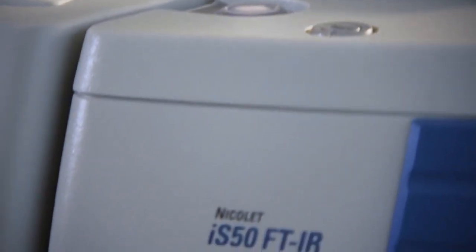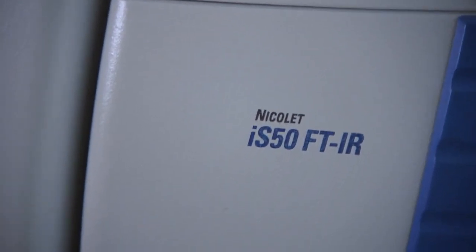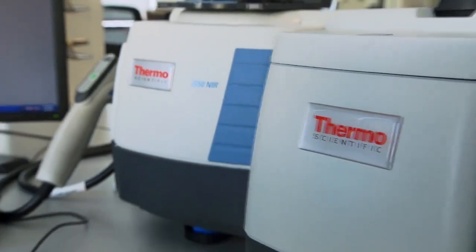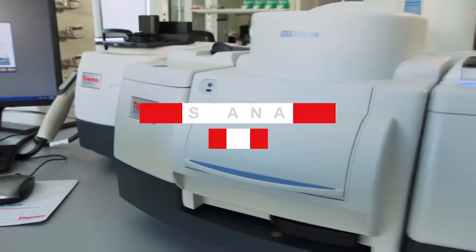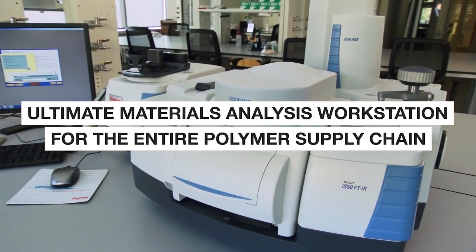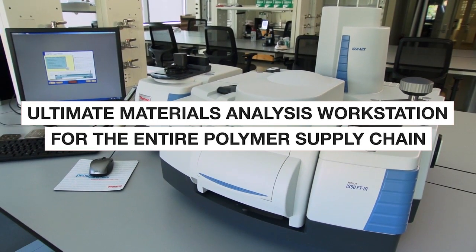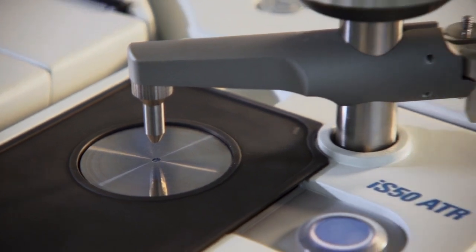troubleshooting, and deformulations. That's why the Thermo Scientific Nicolet IS-50 FTIR spectrometer, with automated optical configurations and multiple sampling stations, is the ultimate materials analysis workstation for the entire polymer supply chain, from raw pellets to finished goods.